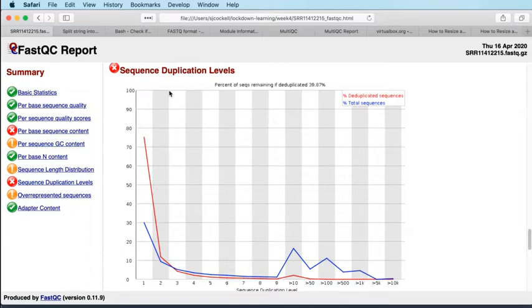And you even expect to see quite a lot of duplication. The level here is relatively high. So only about 30% of the reads overall are unique, which is a fairly high level of duplication, which is indicating that maybe the input amount of RNA into this experiment was a little bit low. So maybe we've got a bit more PCR duplication than we would really like.